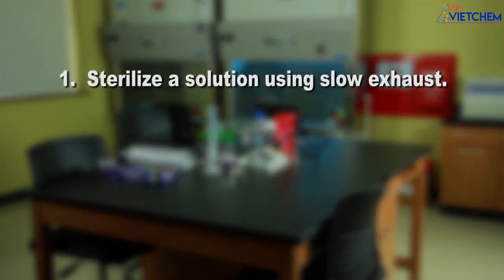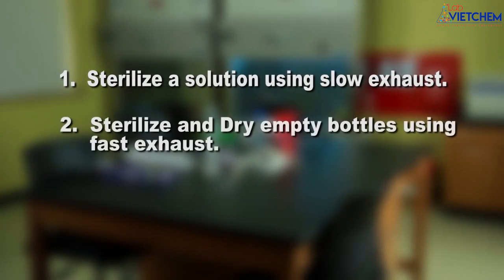First, we'll sterilize a solution using the slow exhaust cycle, and second, we'll sterilize some empty bottles using fast exhaust.